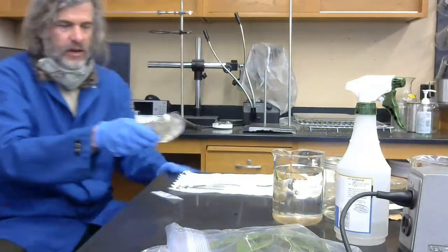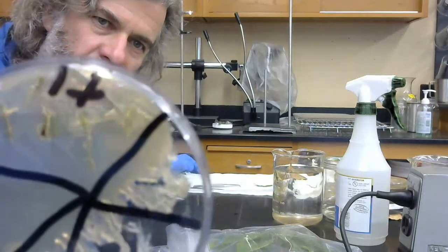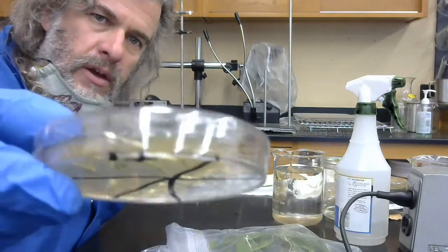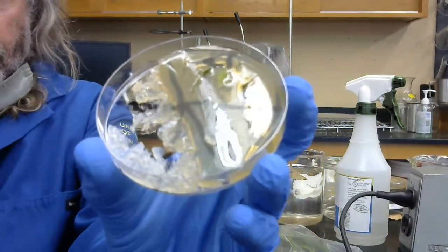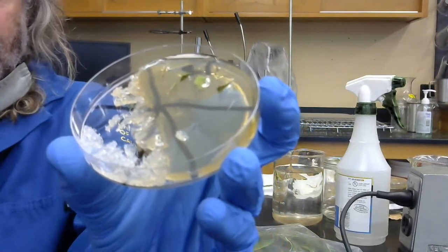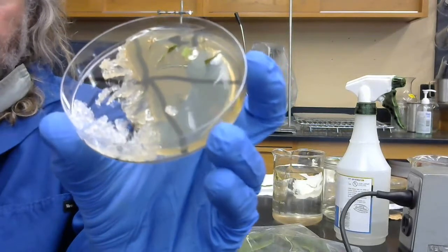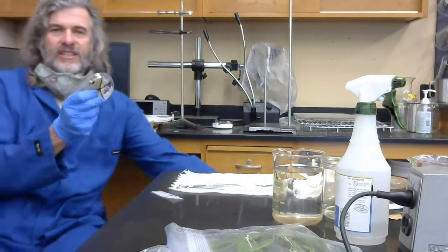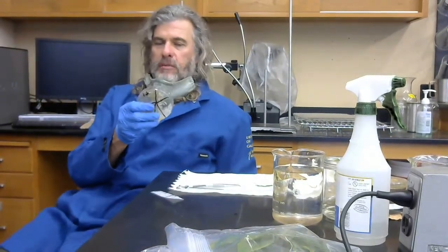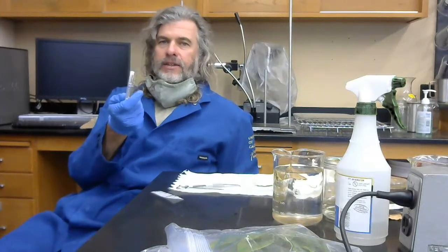Okay, so let's take a quick look here. That's my samples right there. You can kind of see them in the plate. This is not actually going to be grown out, so I'm going to open them, and you can maybe see that parts of them are sticking up out of the media, and then the rest of them are in the media. You're only going to get stuff out of the material that is actually in the media. The portion of the leaf that you've cut up and is in contact with the media, that's where these fungi are going to grow out.